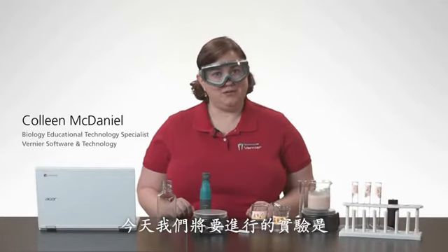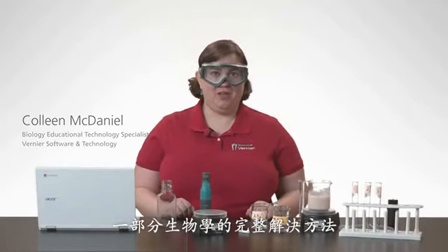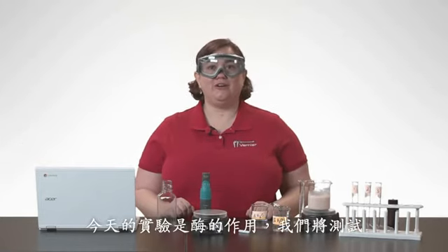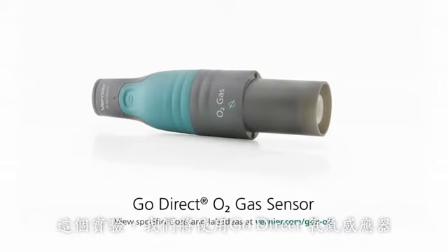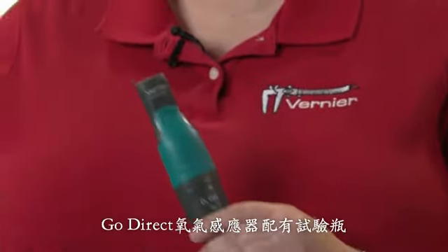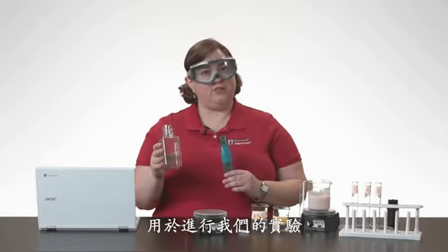Today, we are going to be doing an experiment that is part of the Biology Complete solution. Today's experiment is going to be enzyme action, where we are going to test the activity of catalase. For this experiment, we are going to be using the Go Direct oxygen gas sensor. The Go Direct oxygen gas sensor comes with a Nalgene bottle, which is what we are going to be using to run our experiment in.